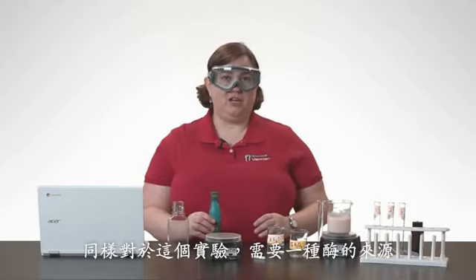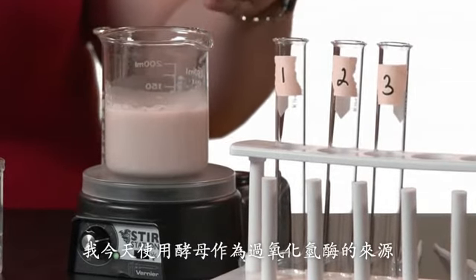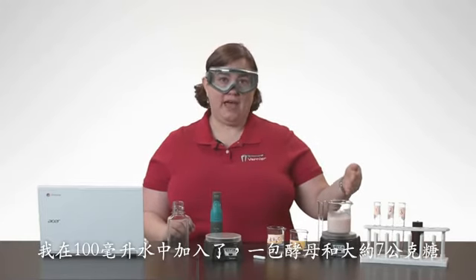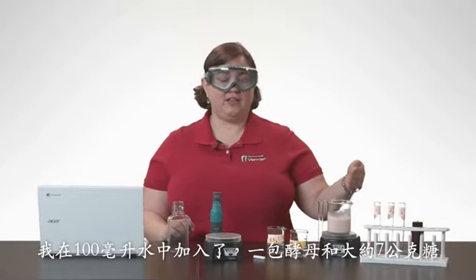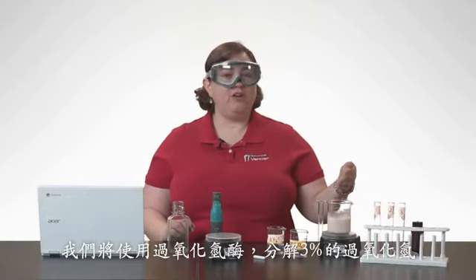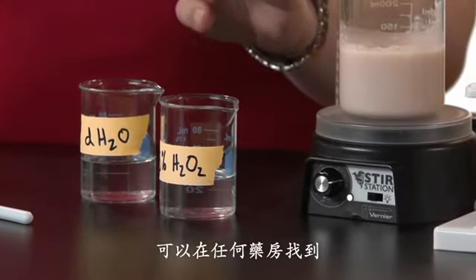Also for this experiment, you're going to need a source of enzyme. Today, I am using yeast as my source of catalase. To create this solution, I used 1 packet of yeast in 100 milliliters of water with about 7 grams of sugar that I let sit on a stir station overnight. We are going to be using catalase to break down 3% hydrogen peroxide, which is something that you can easily find at any drugstore.